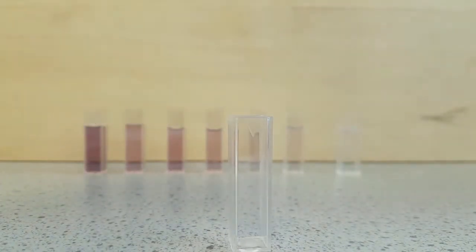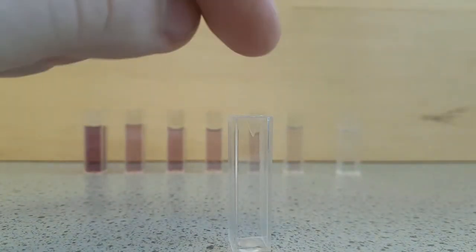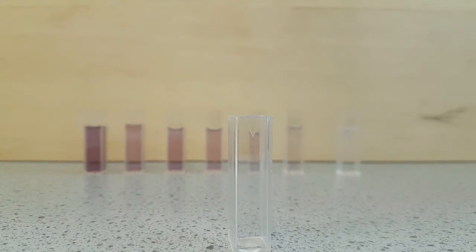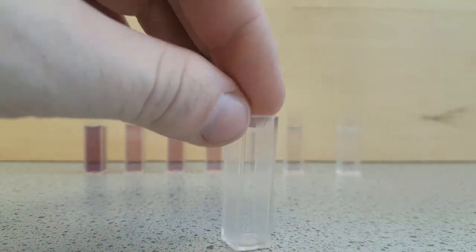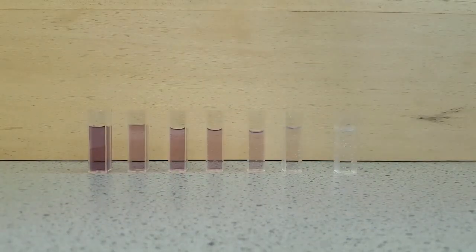There's also a triangular marker which you can just about see at the top of this cuvette here. I tend to use that as a marker when filling up the cuvette, so I don't go past that marker. You don't need to fill it up to that marker, but as long as your sample is higher than where the beam of light passes through.